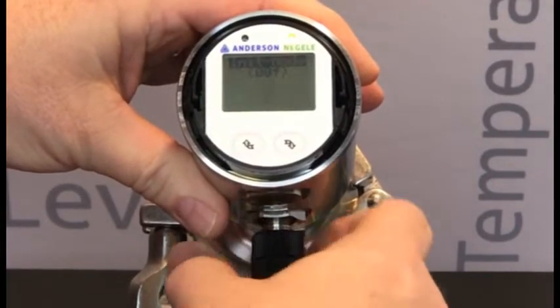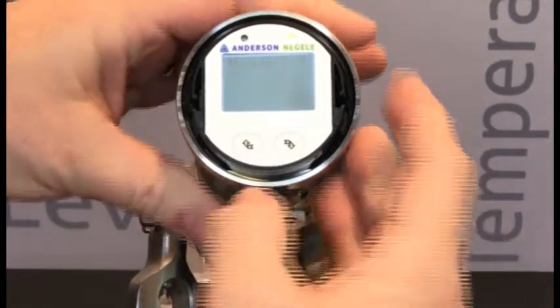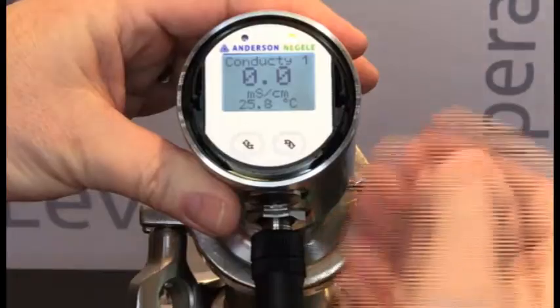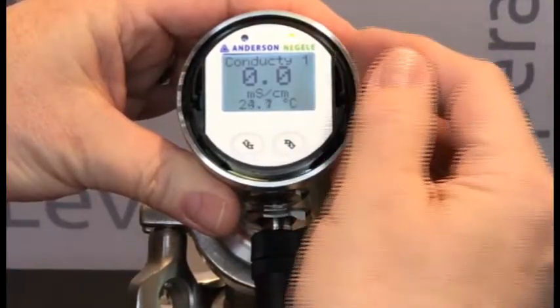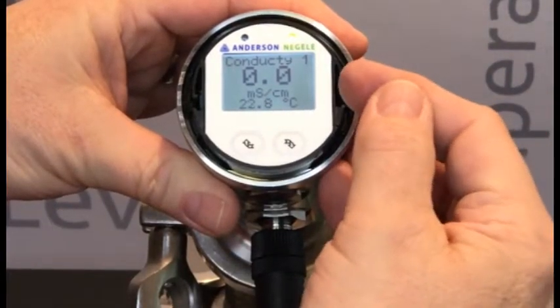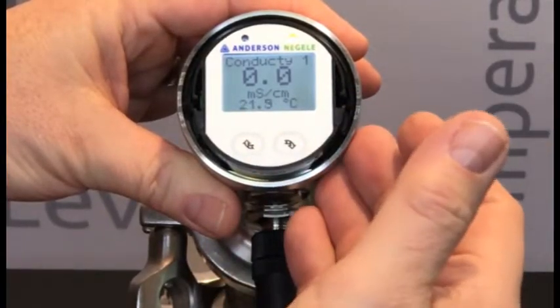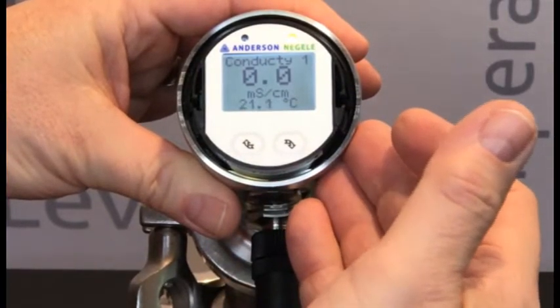You can see it goes through a short boot screen, and when it does that, we now have a display, which is our startup menu. This is going to give us indication of the primary conductivity measurement along with the temperature measured at the tip of the device.